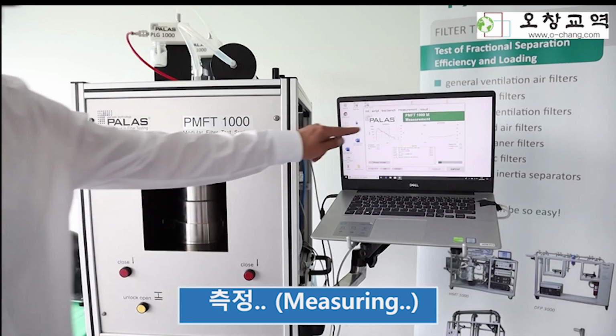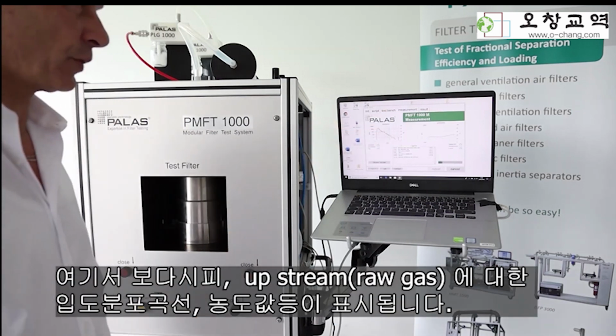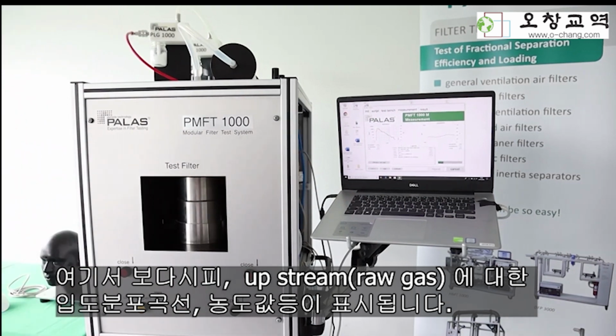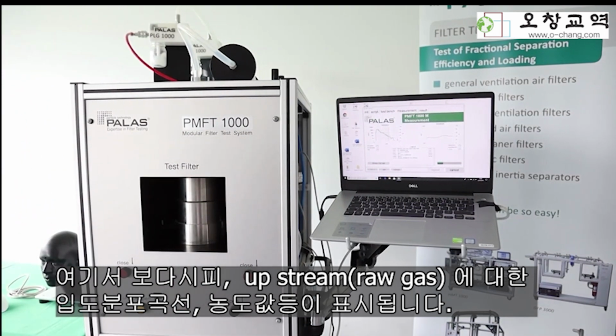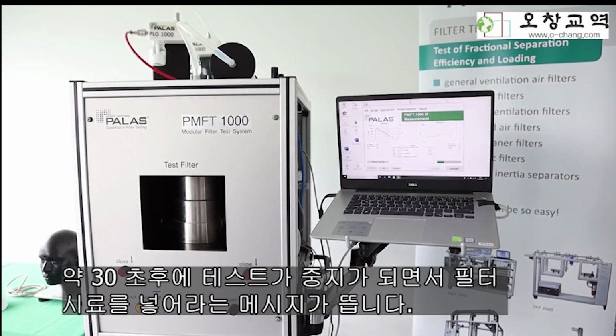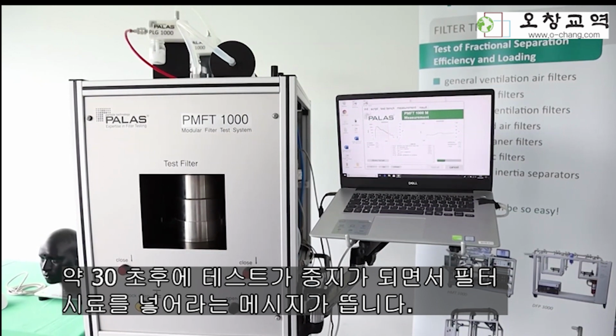You can see here now the particle size distribution building up, and our inserted photometer signal giving the value for the concentration. After approximately another half a minute, the test will stop, and waiting for the mask to be inserted.